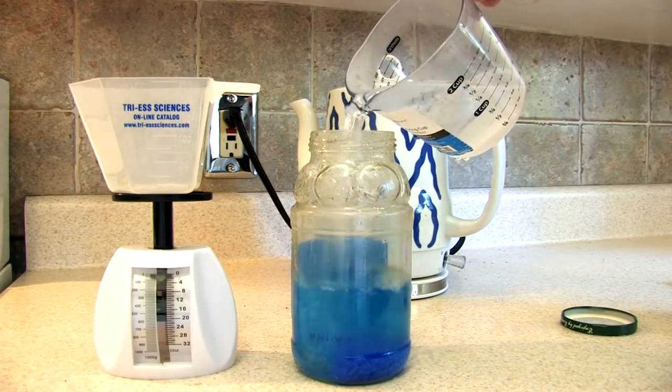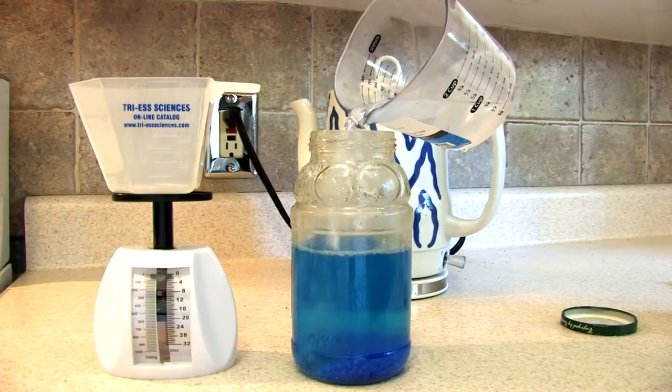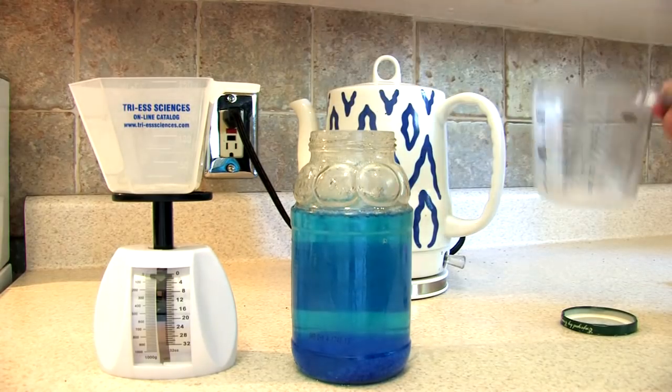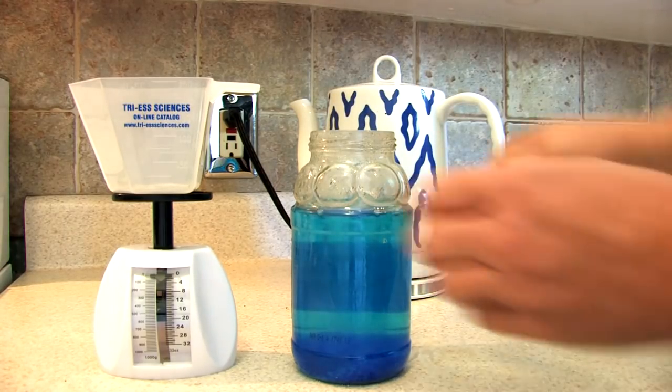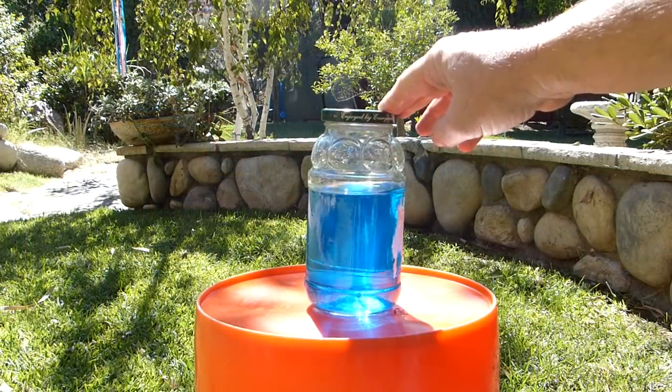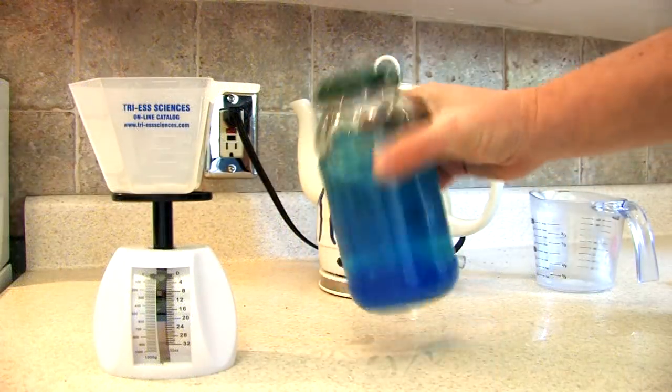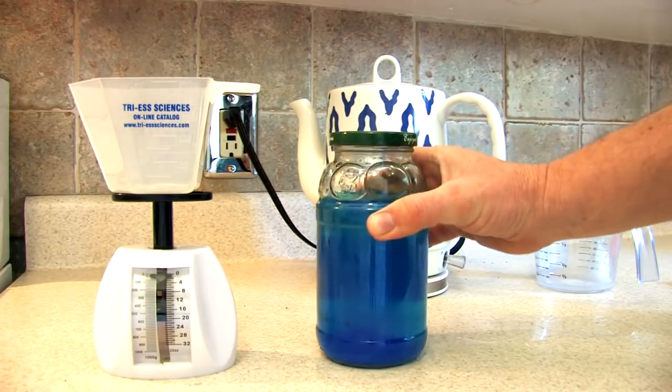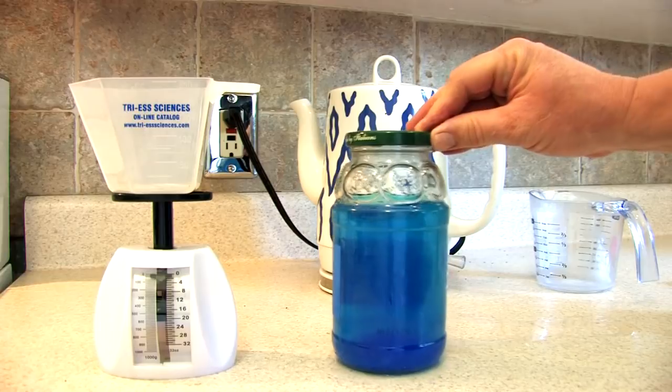I've used a little bit more, a little bit less, and it really didn't make a big difference. We've got our mason jar and we're just going to pour in that boiling water. Now another thing I've done when I haven't been in a hurry is to just put regular distilled water in here and then set the jar out in the sun, and it got warm enough to do some halfway decent plating.